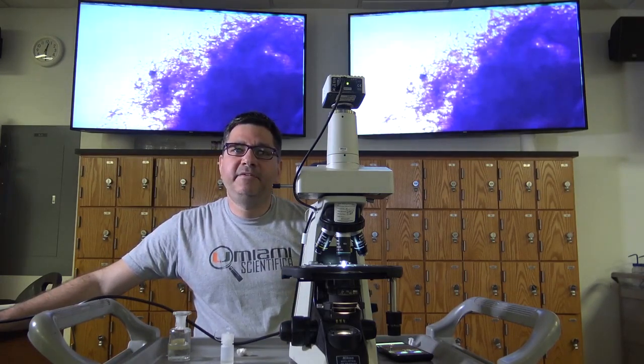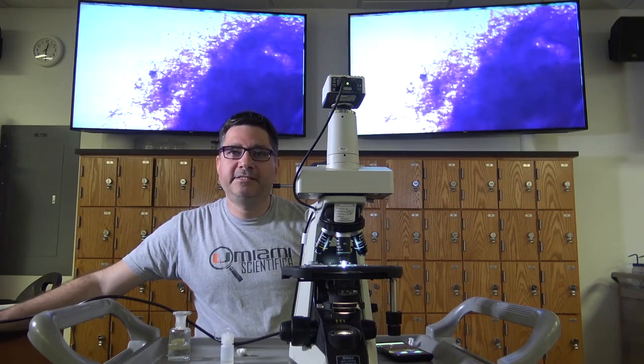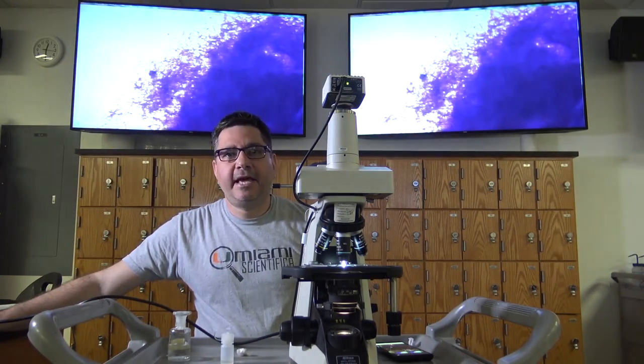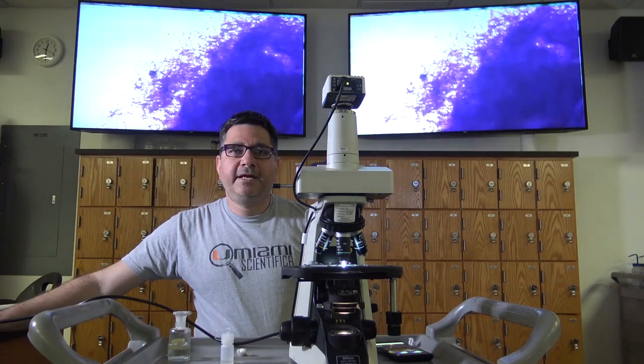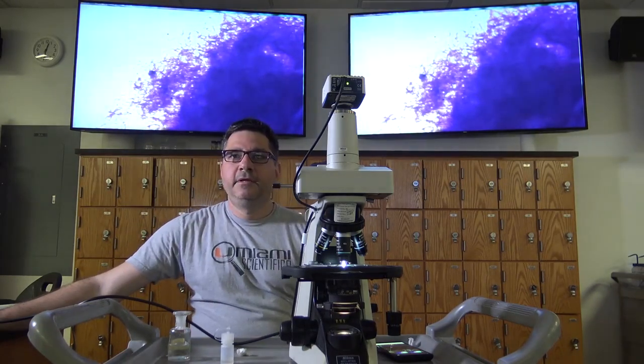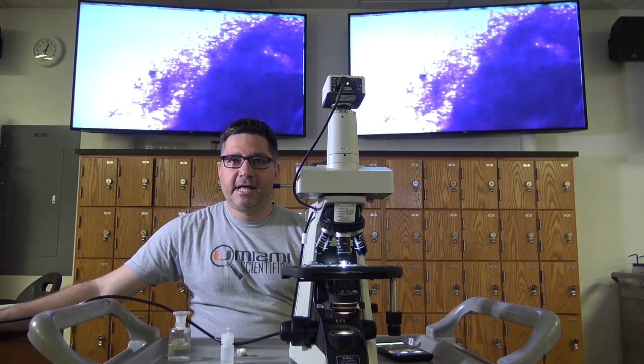Please note, at this magnification, the specimen will not be clearly visible due to the refractive qualities of the glass and air between the objective and the slide. Once you can see your specimen, increase your magnification once again. When using the 40x objective, care should be taken to view organisms that are not fixed to the slide. The 40x objective should never be used when there is oil present on the slide.